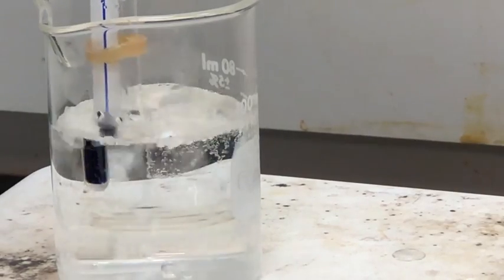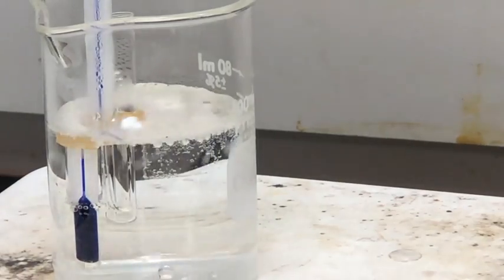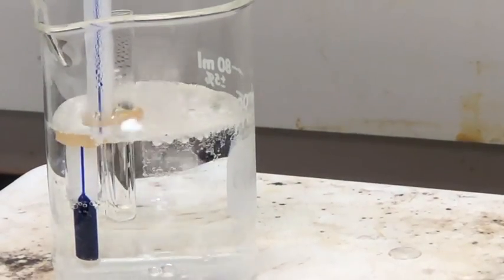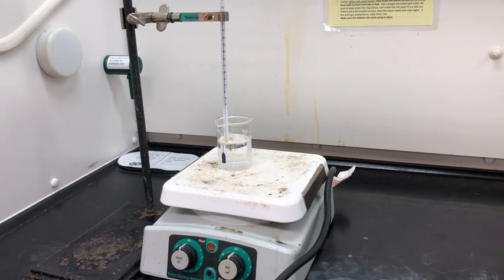It's a little hard to show you the thermometer and the boiling tube at the same time, but I will give you a data table of all of the boiling point temperatures for each sample. That way you don't have to watch me do this 4 different times, but I did want to show you how it works. So now you can compare the boiling point of the unknown to the other boiling points. And now we can narrow down what our unknown compound is.